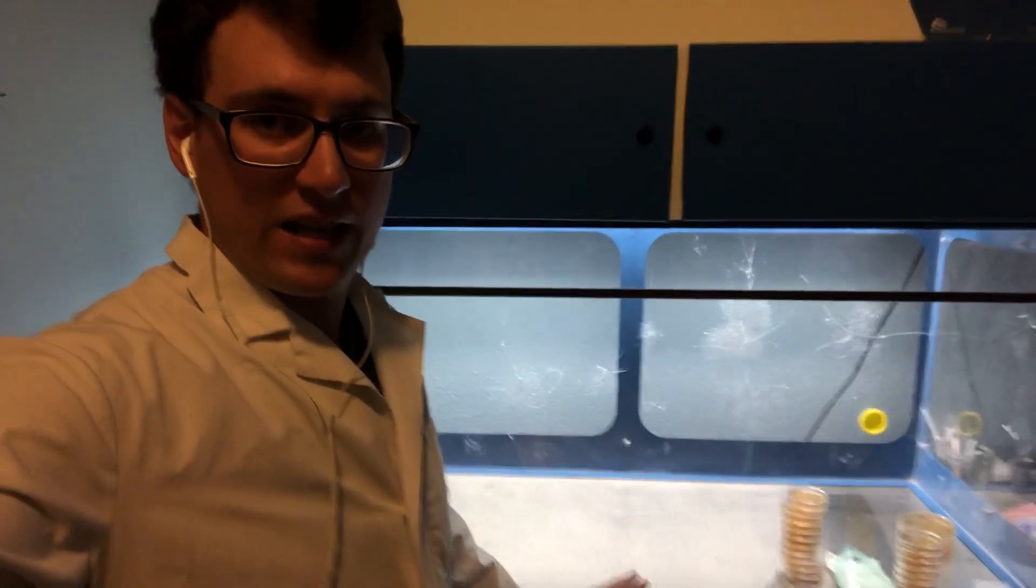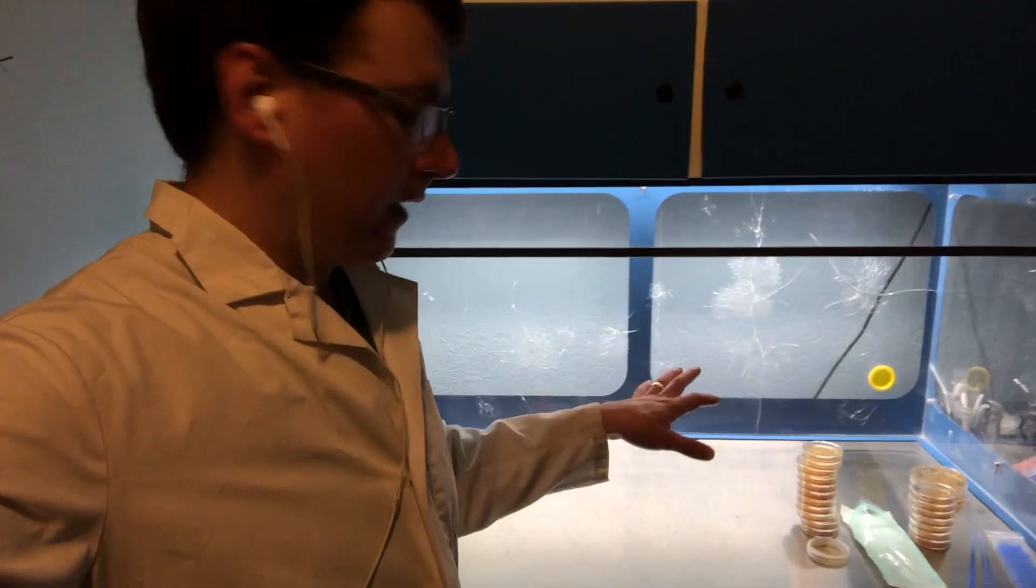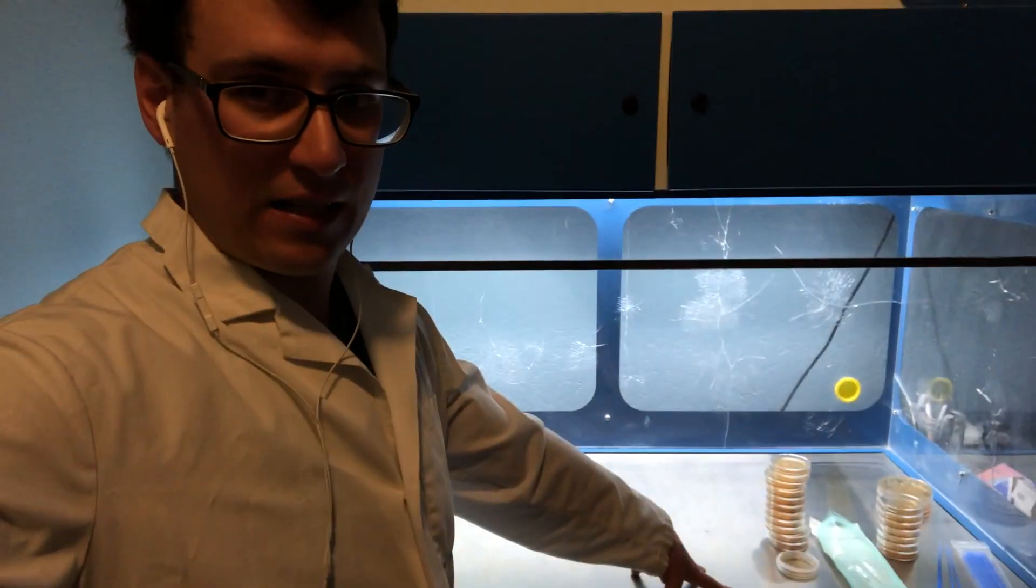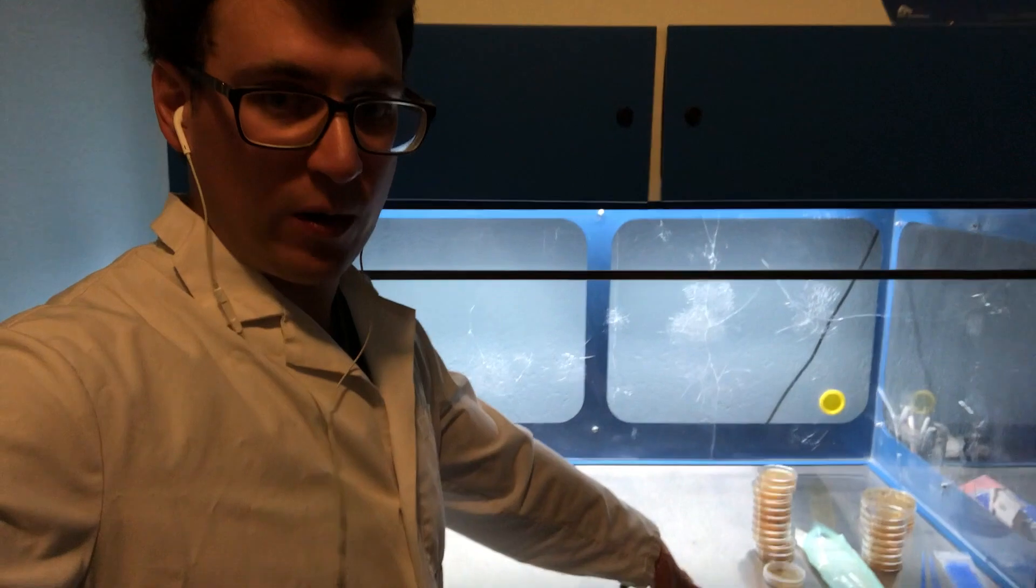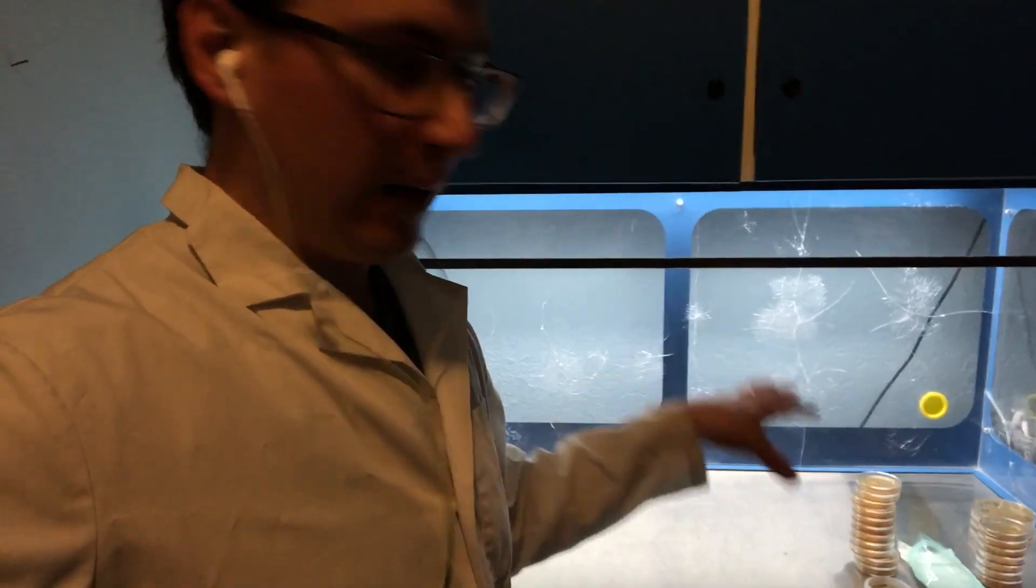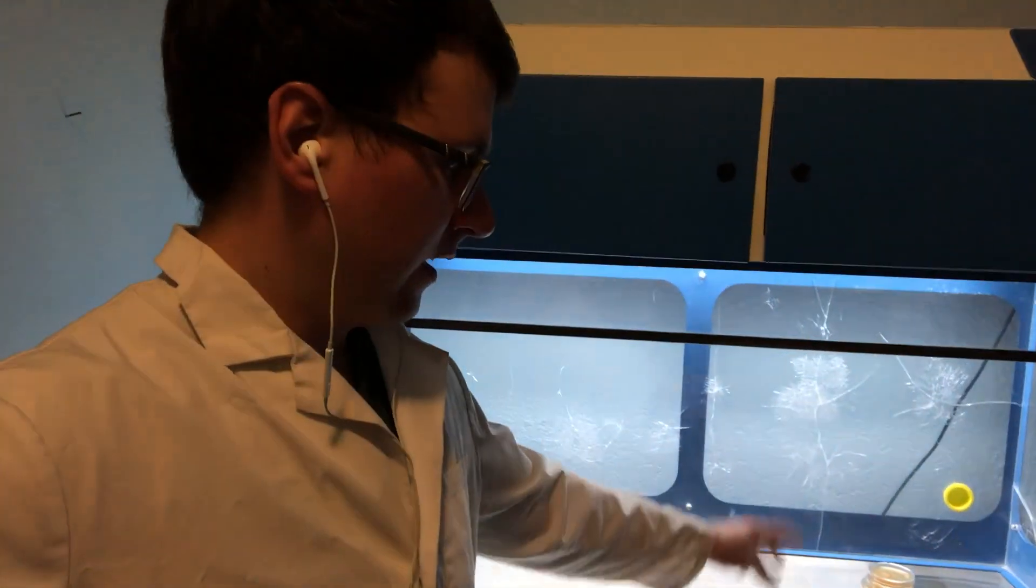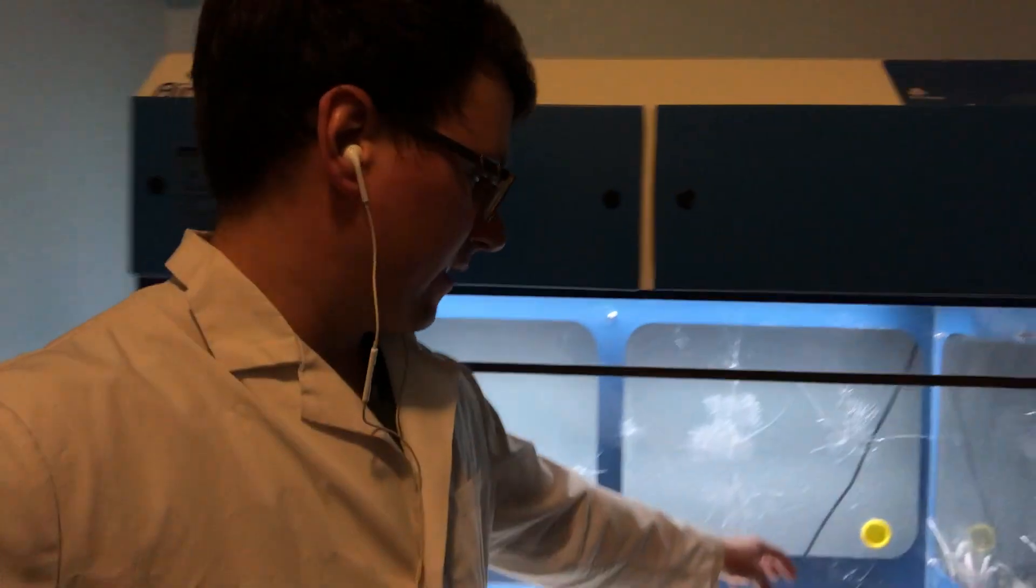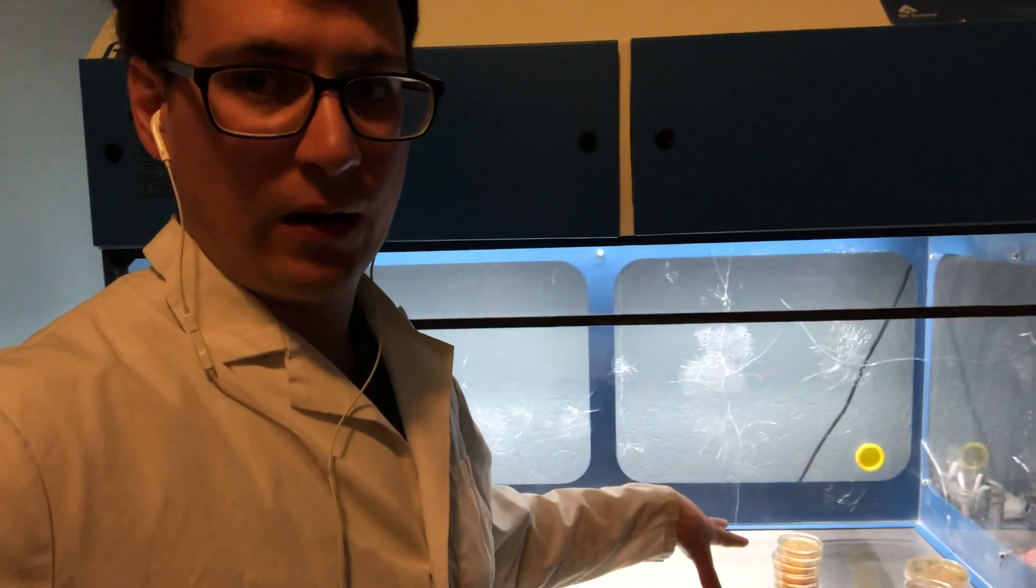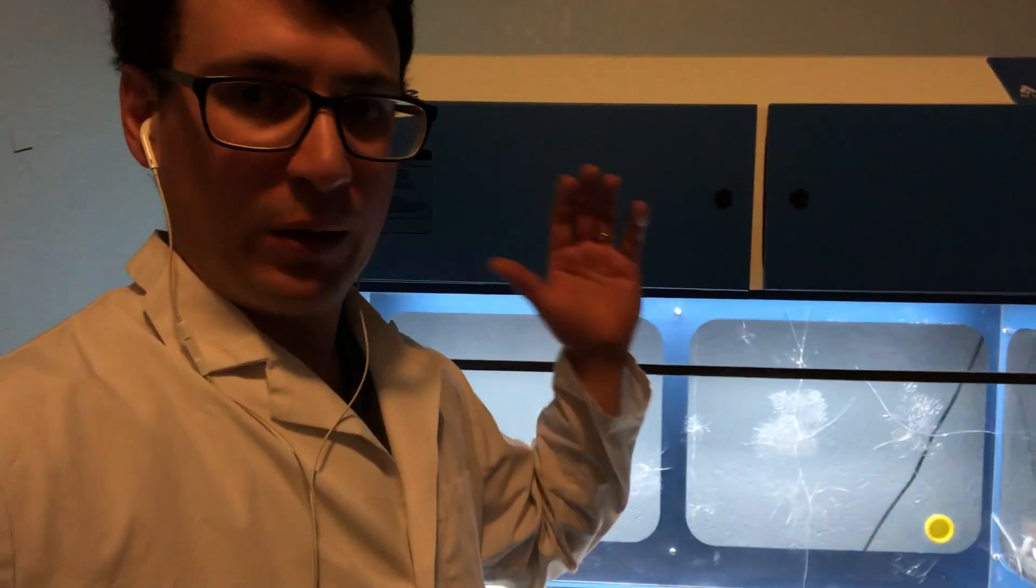Okay guys, so that is the update on day six. I just made about 18 isolates of this pink oyster and I'm going to parafilm these and put them in the incubator which is 72 to 73 degrees for about four or five more days until these isolates grow out.